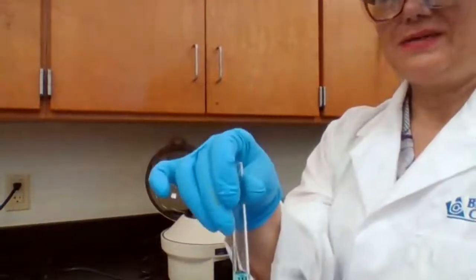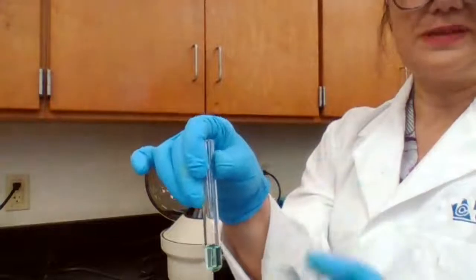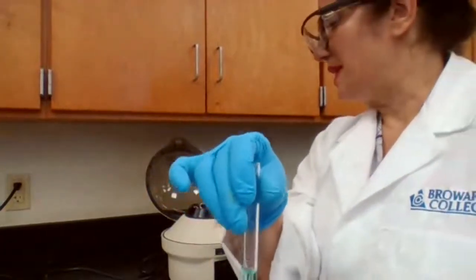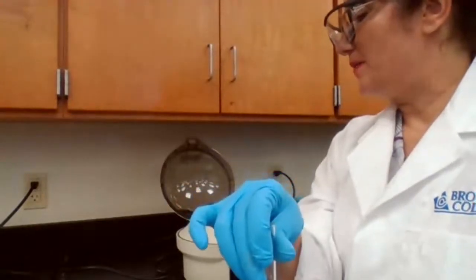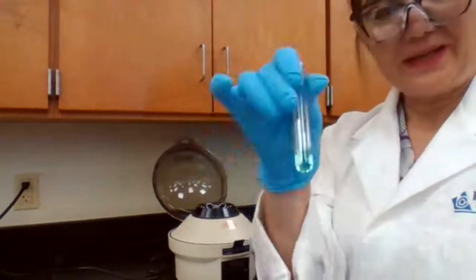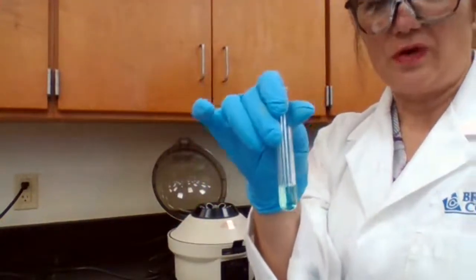If there is any lead, we have to remove it because it would interfere with the result of bismuth and copper. Have to remove lead, that is part 2A.